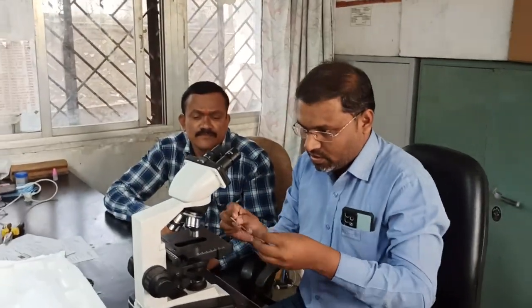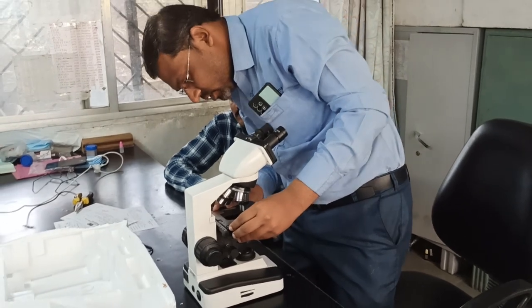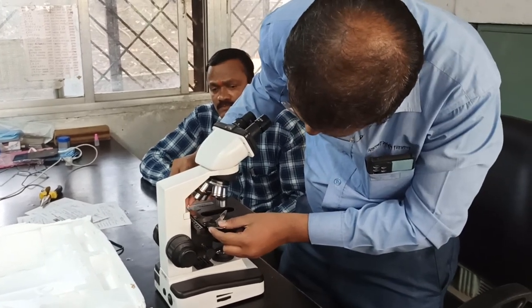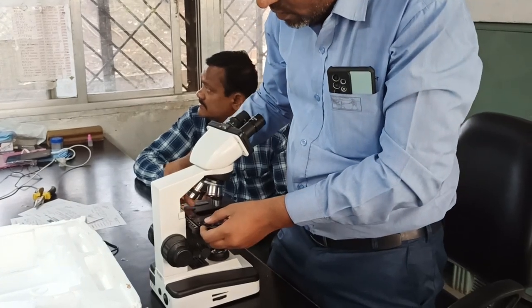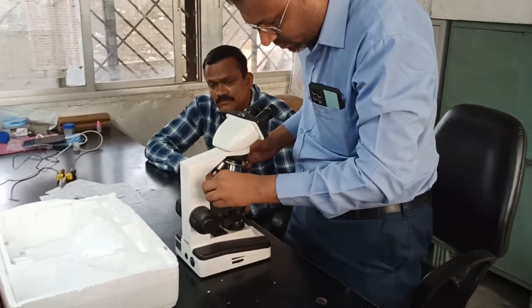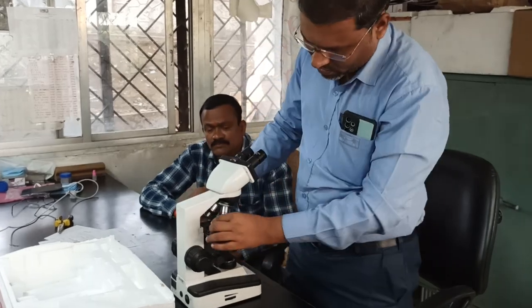One more thing is remaining. This is the adjustment for the slides. It is called the stage clamp. For this, they have provided two holes, for which there are two Allen keys, to fix it like this properly. Make it tight. So our microscope is ready for use.